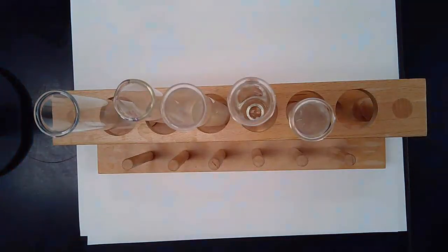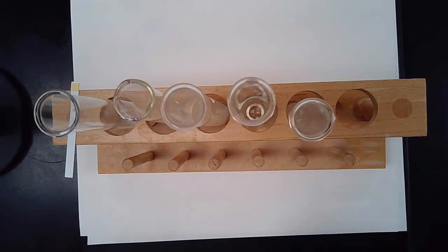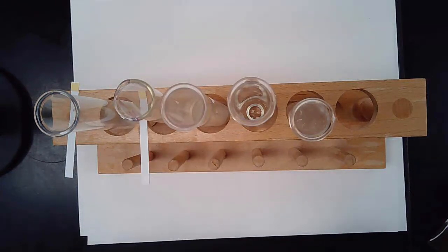A few minutes later. And it's been approximately 10 minutes. I know, it seemed like it just flew right by. And what we're going to do is get out our test strips. Now, again, you'll notice that these strips are yellow at the ends because they have not been exposed to anything. So they are currently reading 0 glucose.